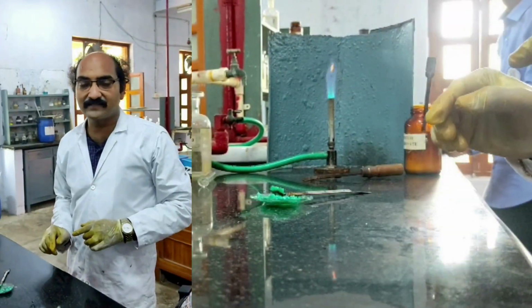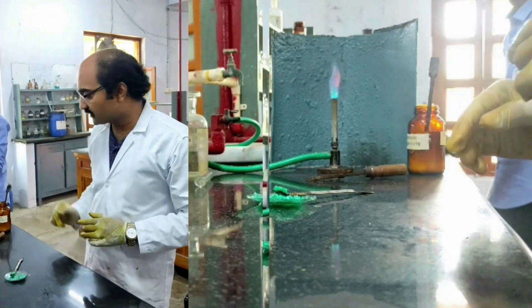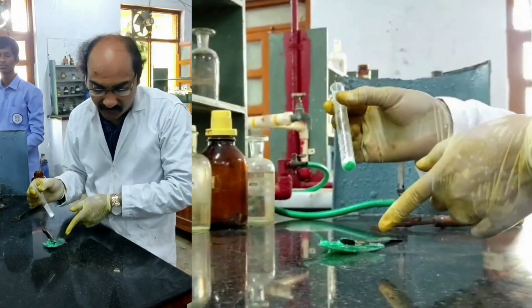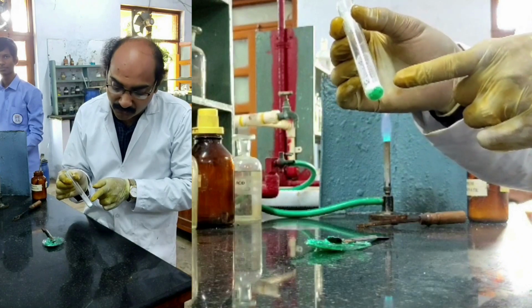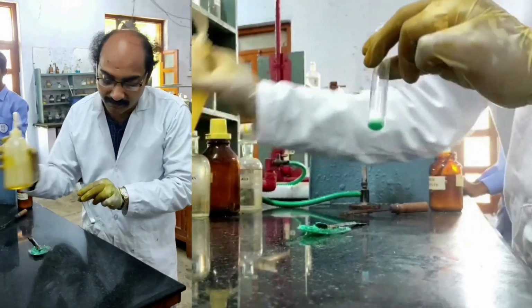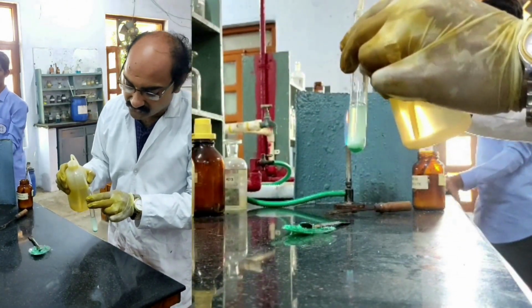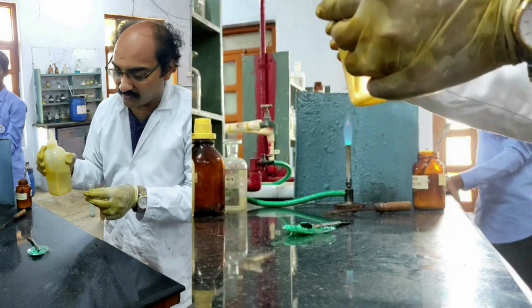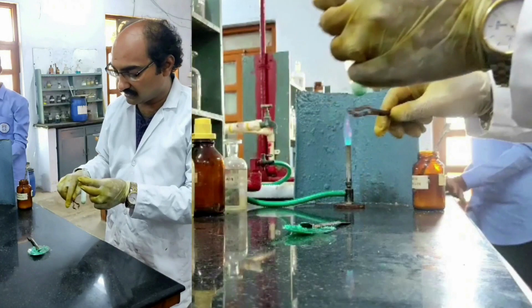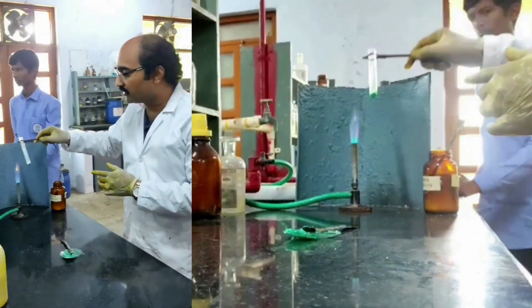Do the wet test. I need to prepare sodium carbonate extract. How do I prepare sodium carbonate extract? I have taken 1 part of salt mixture and added 3 parts of sodium carbonate solid, and a sufficient amount of distilled water is added to this. Now I am heating this mixture with the help of a Bunsen burner by putting it in a holder.